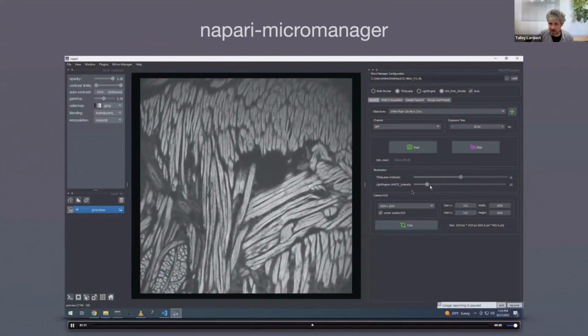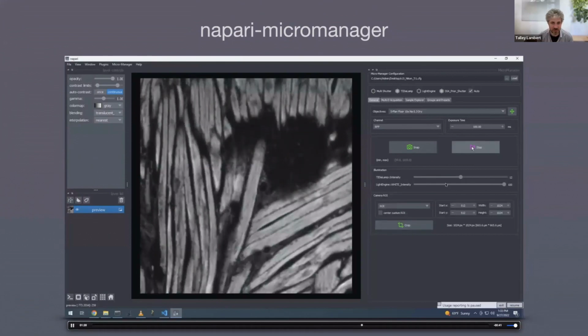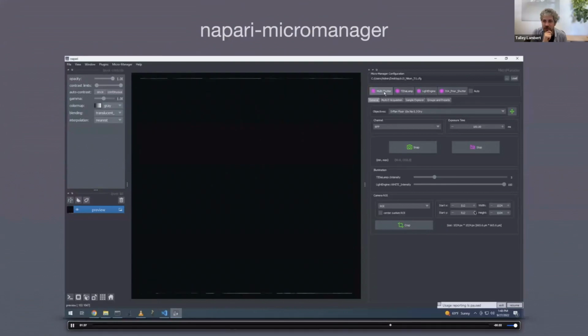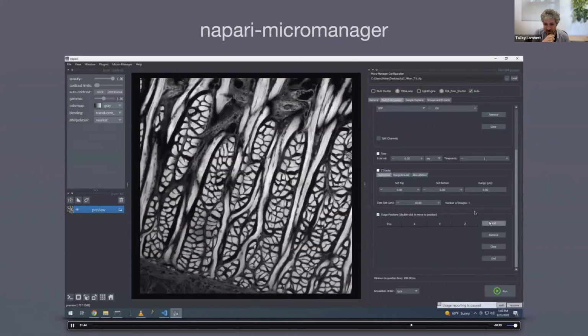This, I think, now is going to be an example of illumination, right? So point being, we have pretty good complete control of most hardware as you would in Micromanager. Changing the exposure time, cropping. I think he's going to crop down to a smaller subset, go live again. Finally here, what do we got here? Various cool auto shutter functionality that Federico implemented.